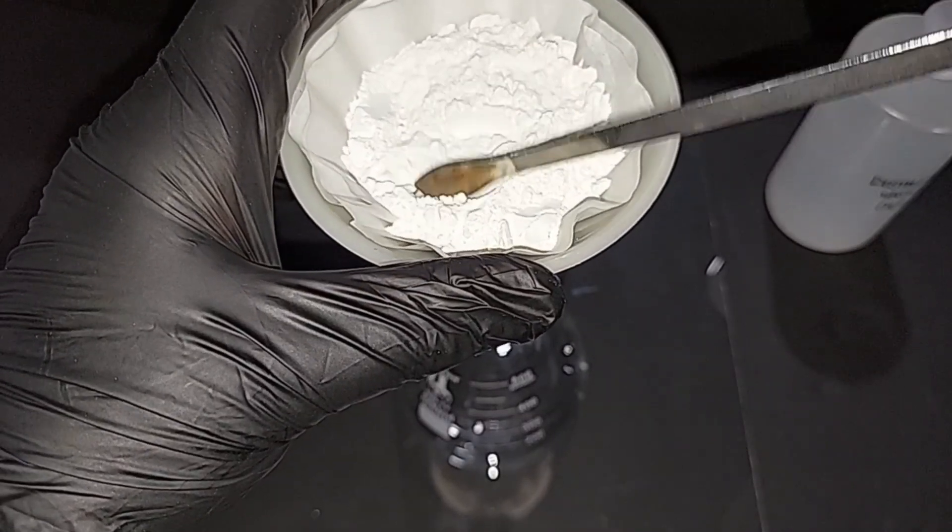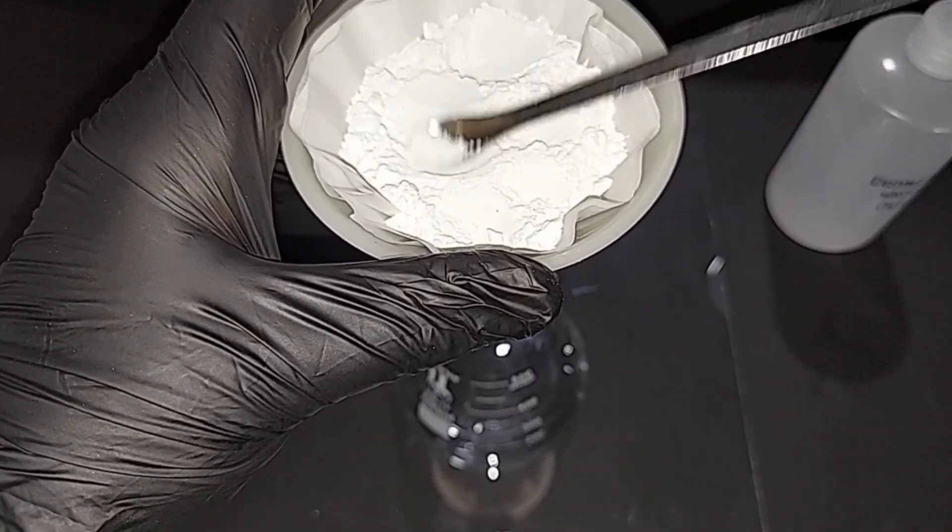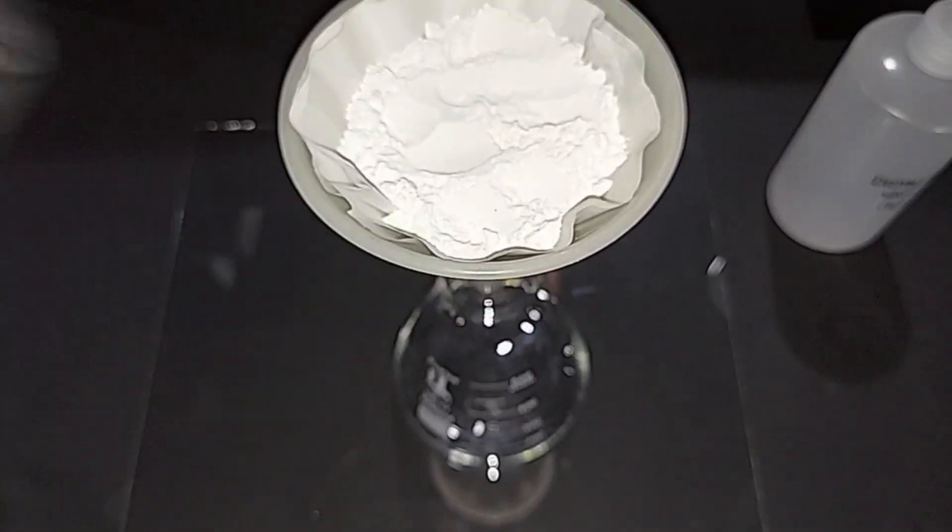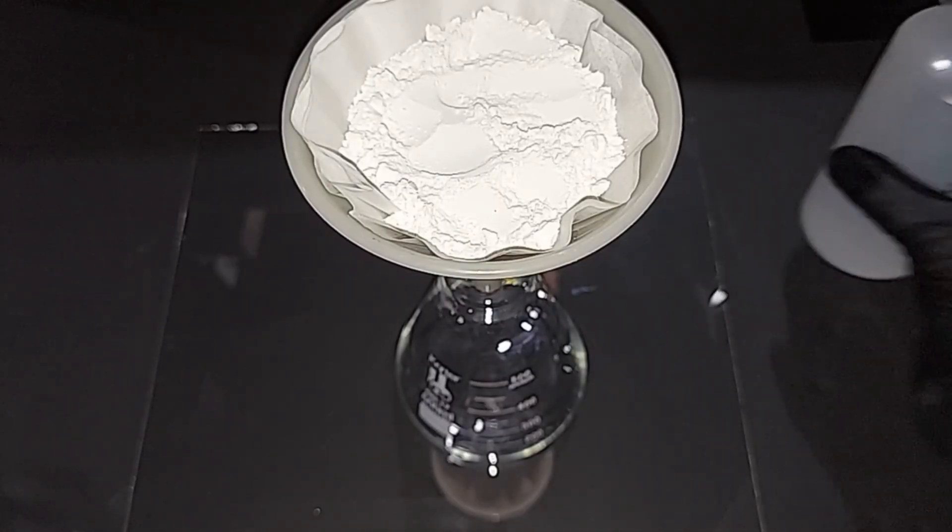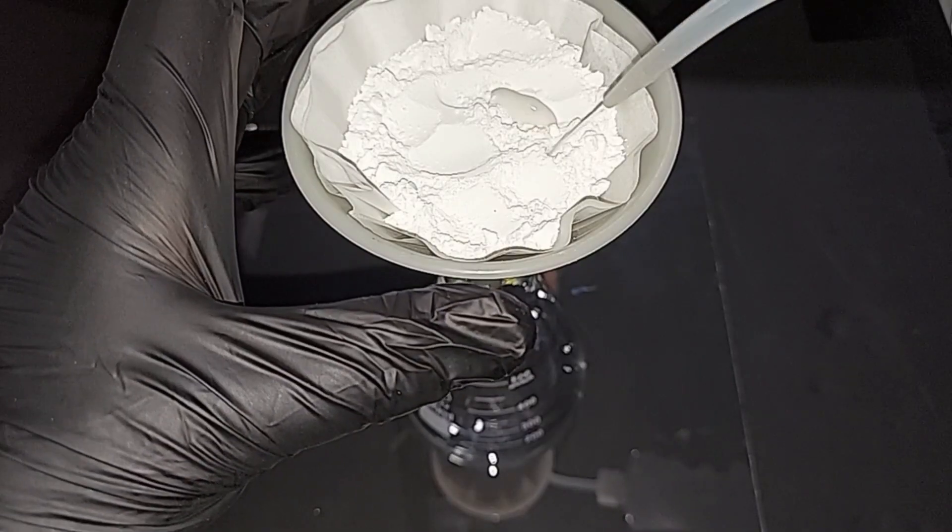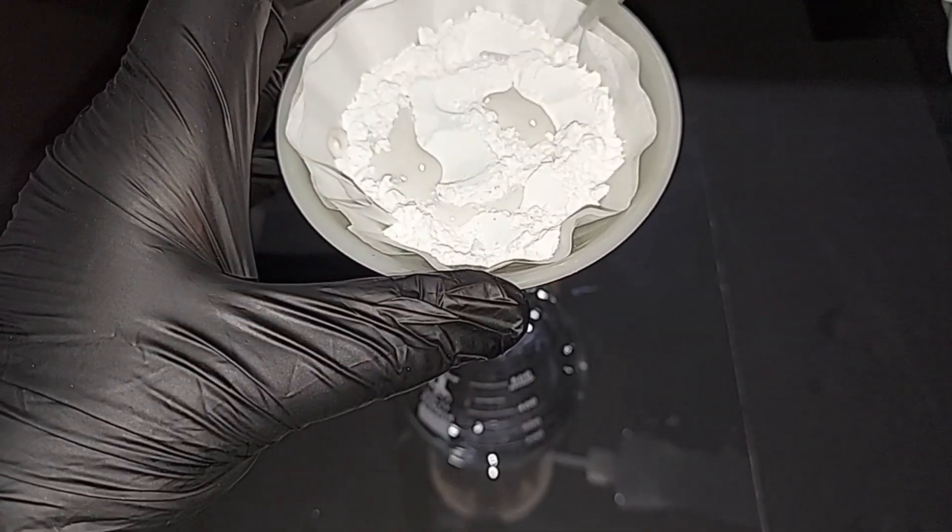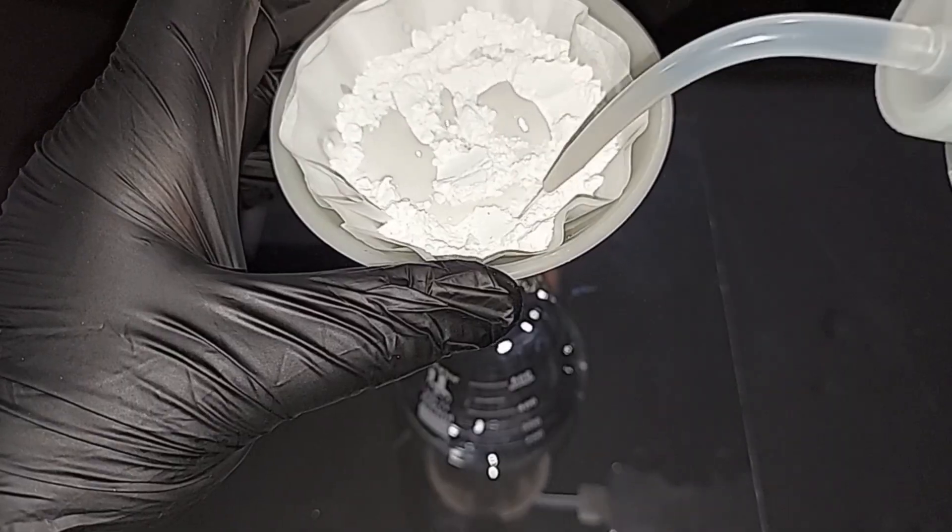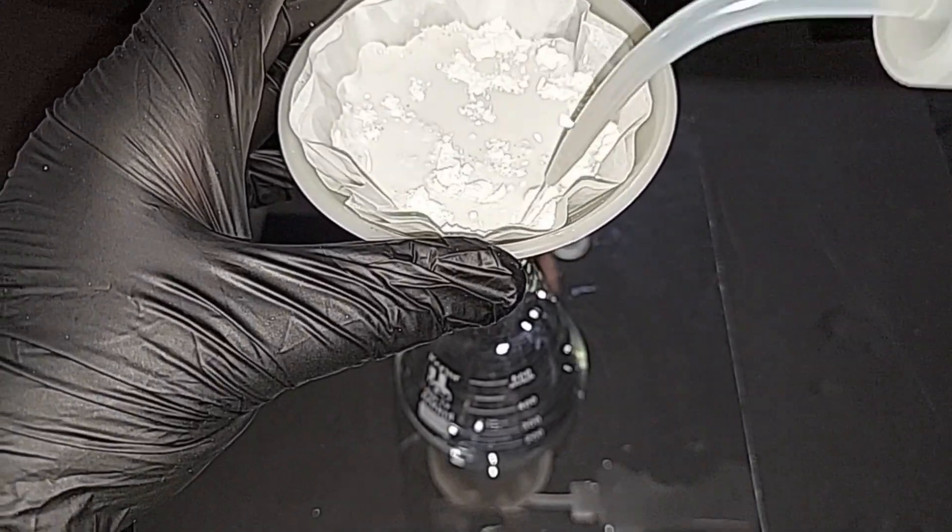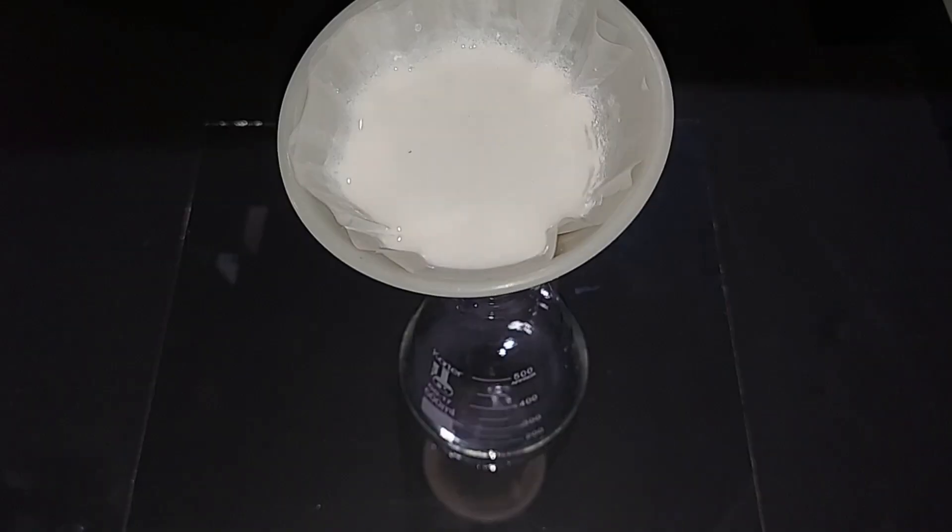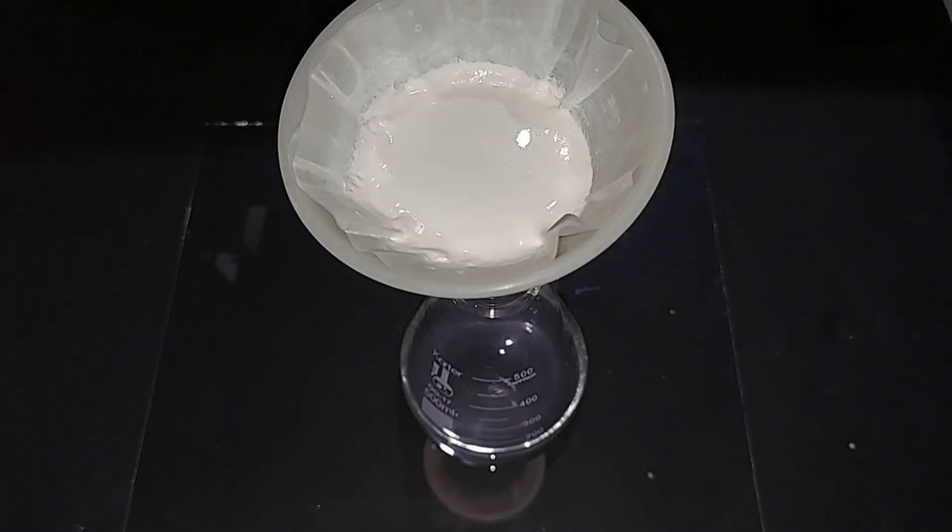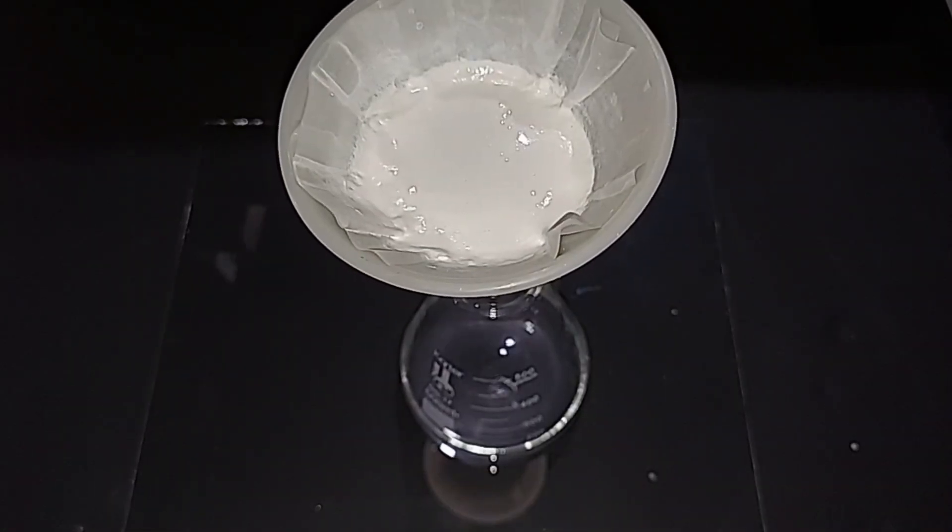Okay. I'm just leveling off the top, trying to make the water go through there as evenly as possible. And I'm not going to hold myself to just a certain amount of distilled water. It just means we have to evaporate more in the end, but my interest here is getting all of the sodium nitrite out of here as possible, meaning it might take quite a bit of soaking. I don't know how many times I'll do this, but I'll continue to do it until it looks like it's done. It's still dripping, but very, very slowly. So I'm going to call it quits here, but I'm going to show you something here in a sec.